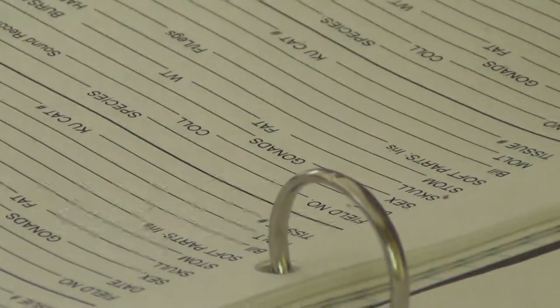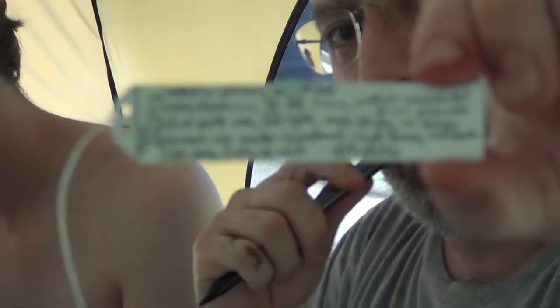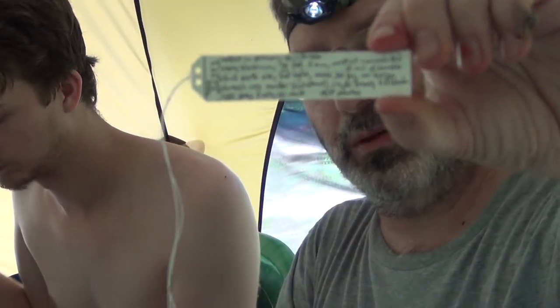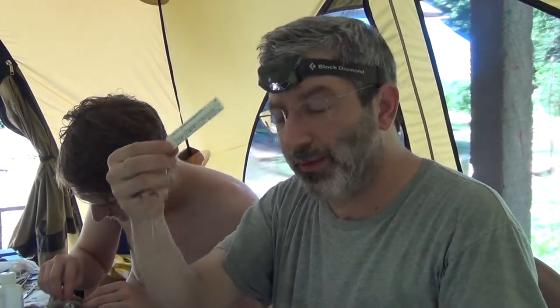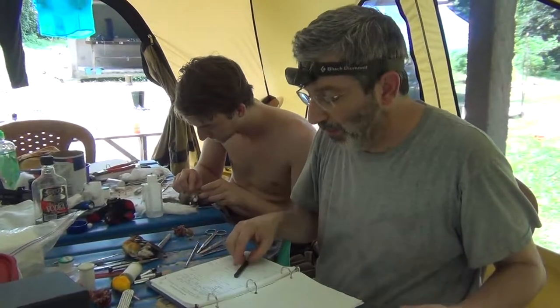There is the second side of the label, and again it's giving us all the other information. The critical thing is that all this data is also here on the catalog, and those two things give us a bit of security about keeping this information safe.